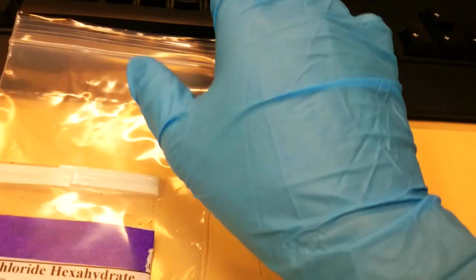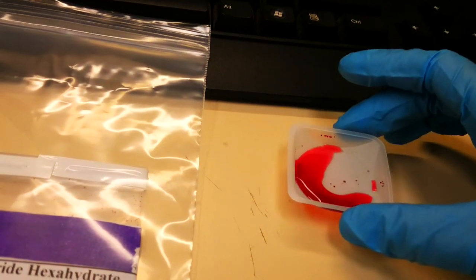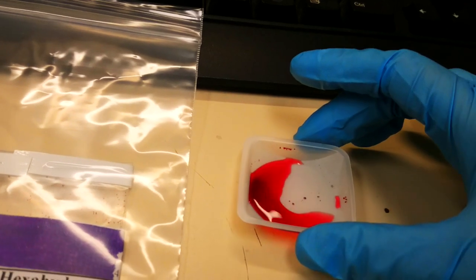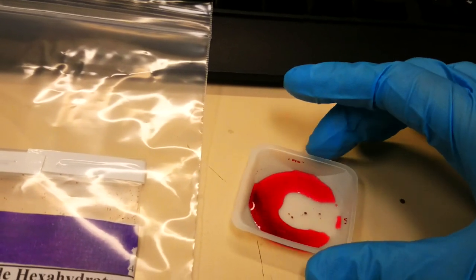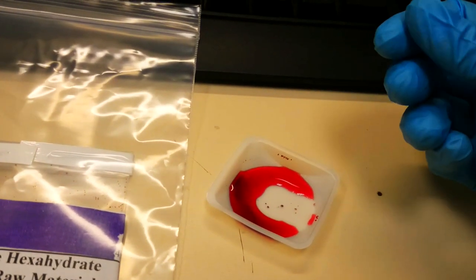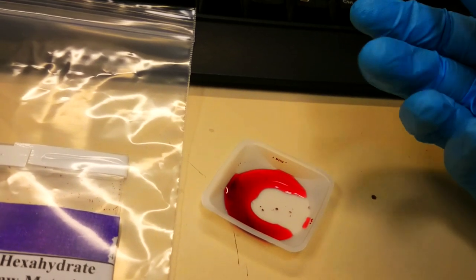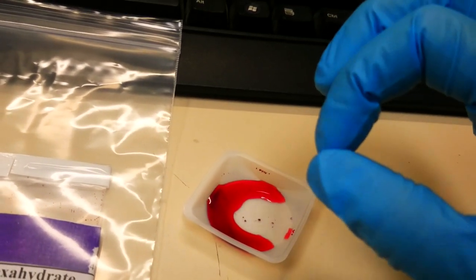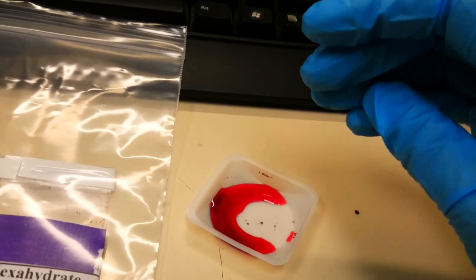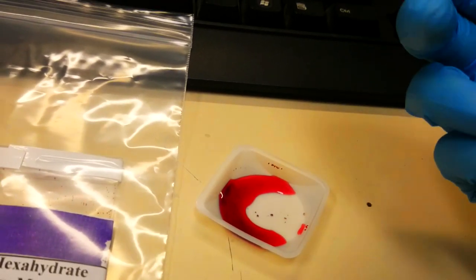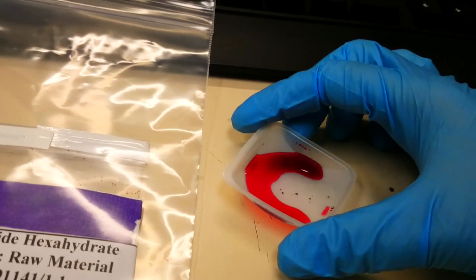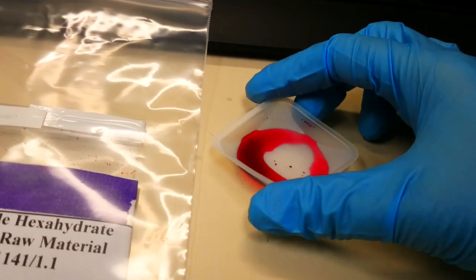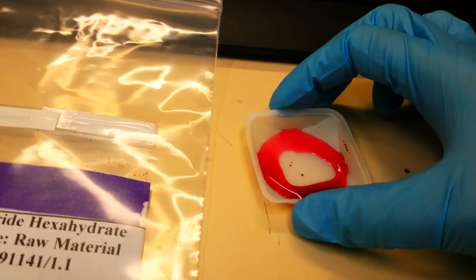Because of the ease of the hydration-dehydration reaction and the resulting color change, cobalt chloride is used as an indicator for water in desiccants. If you're familiar with desiccants, they are usually a completely dry powder used to absorb moisture. You'll often see little silica packets in food or electronics. Those are desiccants, and they make sure that no moisture accumulates inside a container. With how easy this material changes color, it is included in those desiccants sometimes to indicate whether there's water there or not.